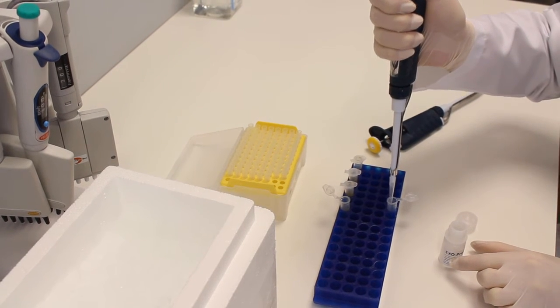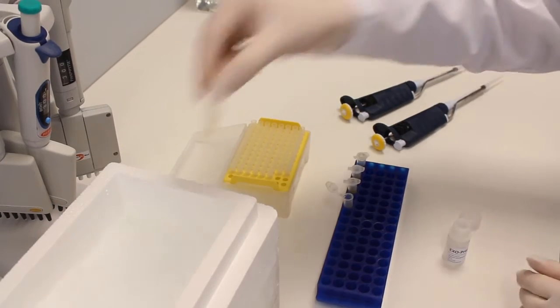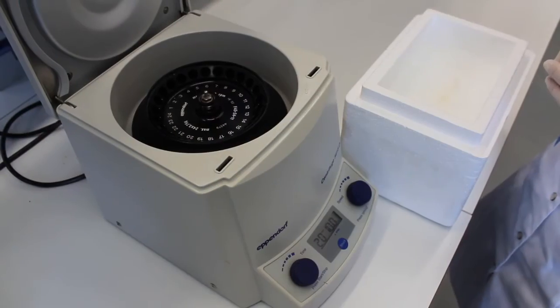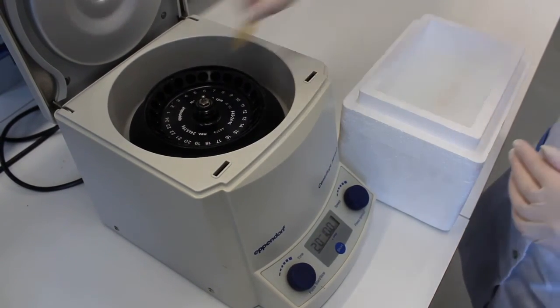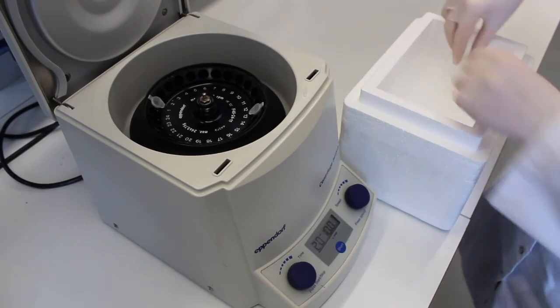Mix well by pipetting. Incubate on ice for one hour. After the incubation has finished, centrifuge 20 minutes at 10,000G.